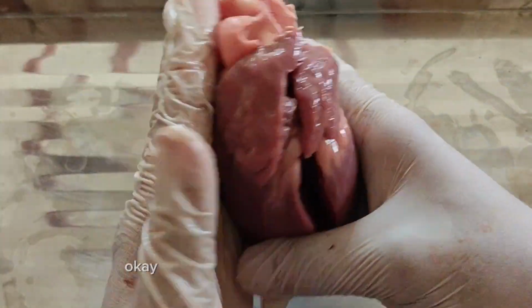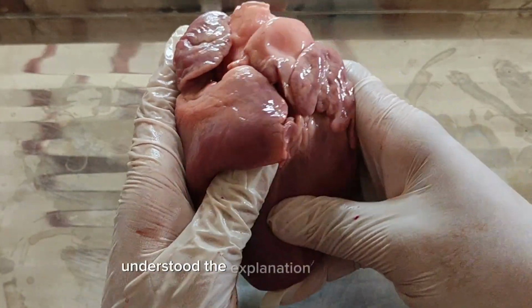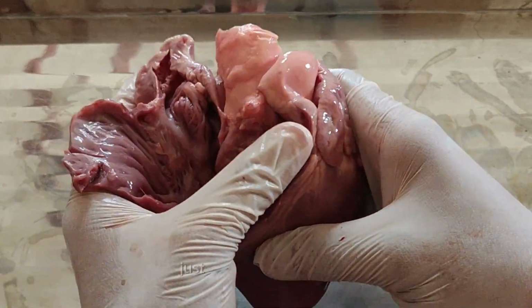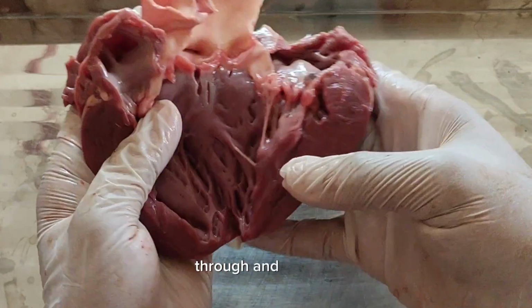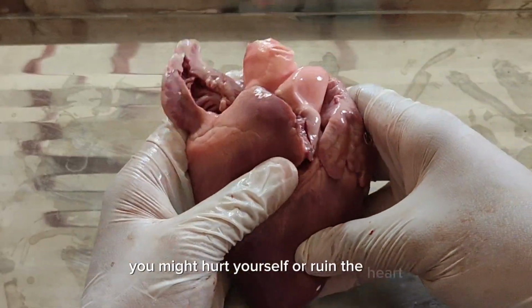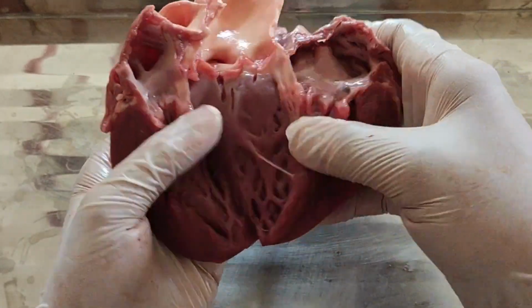Okay. That's it for our pig's heart dissection, everyone. I hope you have learned something and understood the explanation that I have given. And I hope you can follow the incision that I have also done. It's actually pretty easy. Just cut it right open, then through here, through and through. Just be gentle, everyone, do not cut vigorously. You might hurt yourself or ruin the heart, just like I did with the first heart that I had. Fortunately, I have a backup.